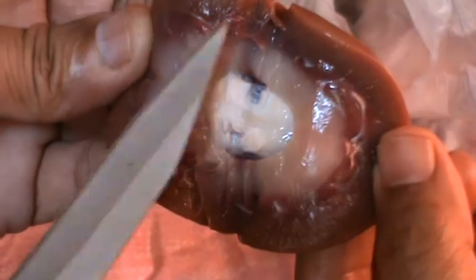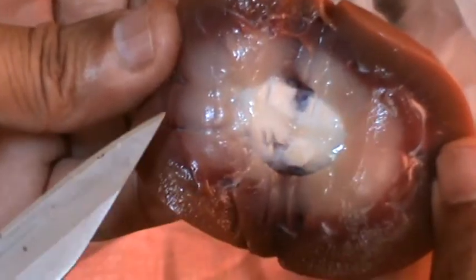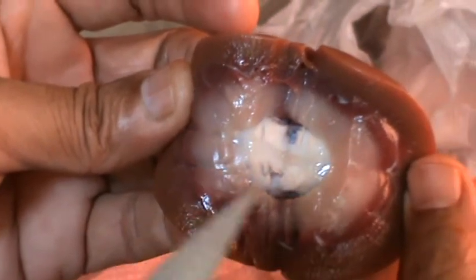So the internal structure of the kidney looks like this: outermost, middle and innermost, and the middle part is medulla, where the kidney tubules are present. Continuously a large amount of blood is filtered and refiltered, and urine is separated from it. Urea, water and other salts are separated.